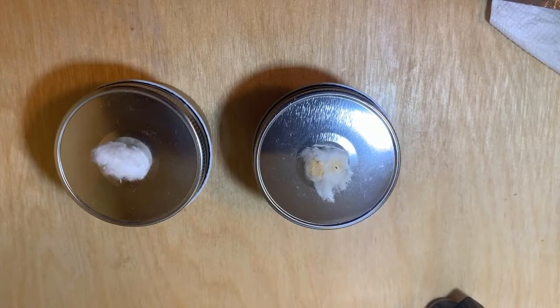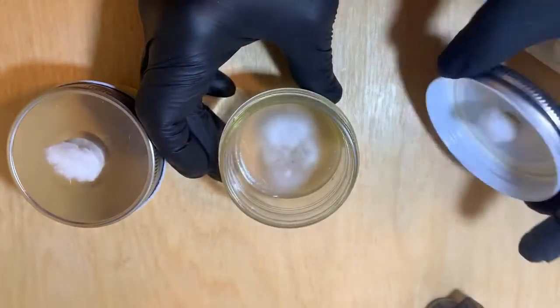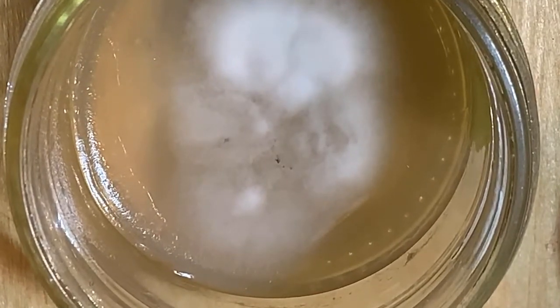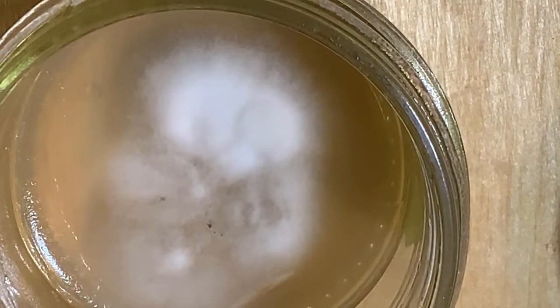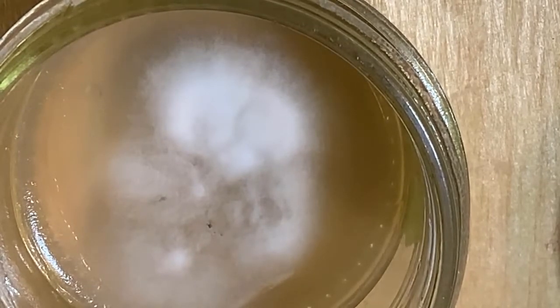What I'm doing today is trying to isolate some regions of this mycelium. This was from a spore print, and when you do a spore print you get many different organisms essentially. I don't want that — I want to isolate a single basic organism that's genetically the same. So I'm going to try to grab a bit from this region and get it into another agar plate.